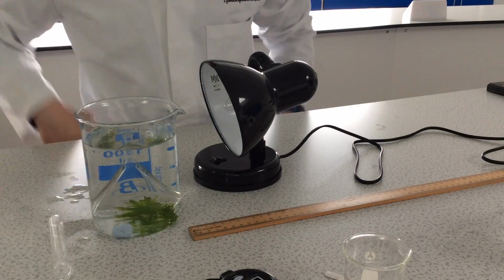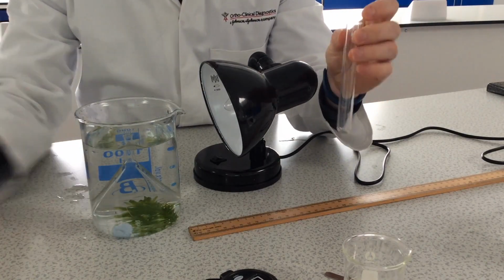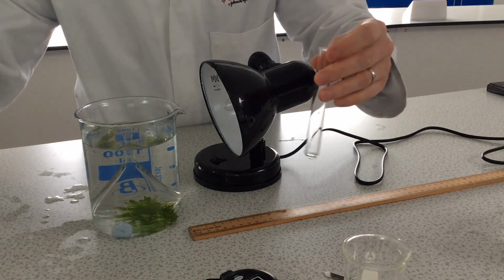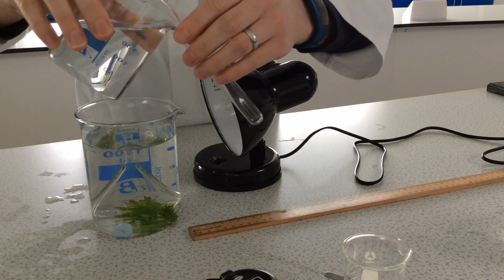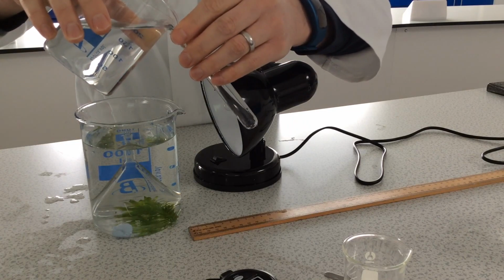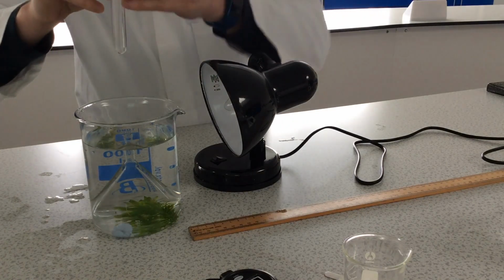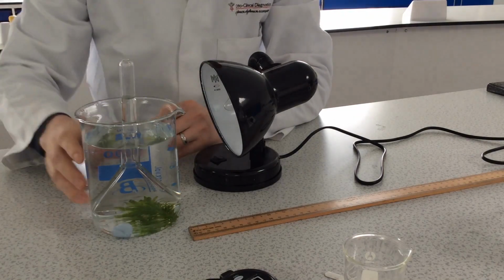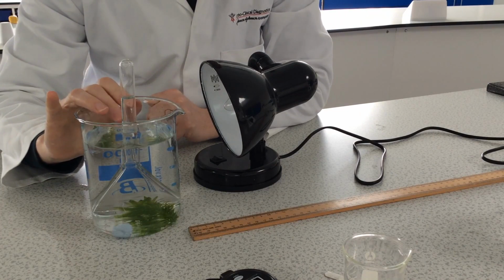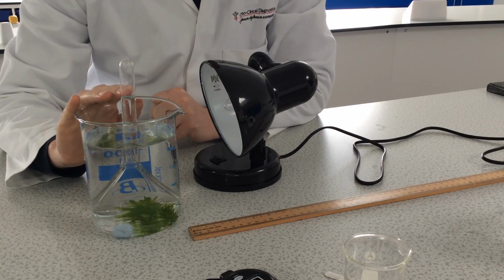Okay. Now, the next stage is to completely fill a test tube with water and carefully place it over the end of the funnel with the end under the water, and if you need to, you could clamp that in place, but I think we don't need the clamp stand, hopefully. And now what you can see is the water is above the funnel, and so the water in the test tube will allow us to see the oxygen bubbles and count how many oxygen bubbles we get per minute.